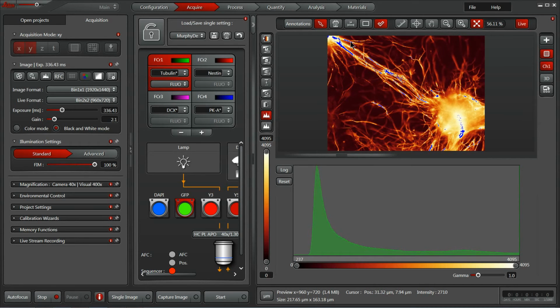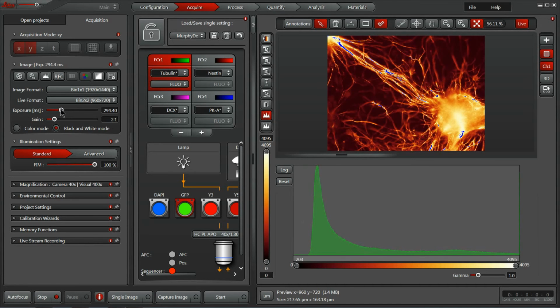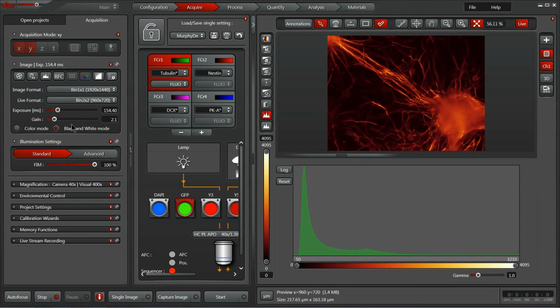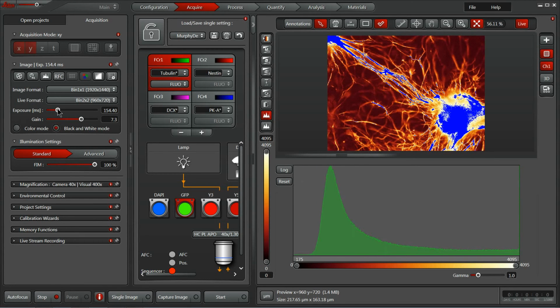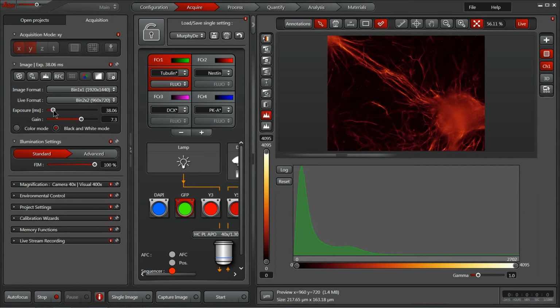So we need to reduce our exposure time to get back within the range of the system, or equally, we can reduce the number of photons that are entering into the system. Now the exposure time is going to affect how long a total experiment time is, or the interval between a time lapse if you're trying to go fast. So it might be beneficial to have more photons entering into the system and reduce your exposure time to be able to keep within the range of the system, but also respect the other dimensional data that you need to get. Equally, you can further reduce your exposure time by applying an analog gain with this particular camera. As the gain increases, you saw saturation. We can reduce our exposure time in that way as well. Still getting an attractive image, but we do start to increase the total noise that's coming into the system with the gain as well. So we've got to use those sparingly.